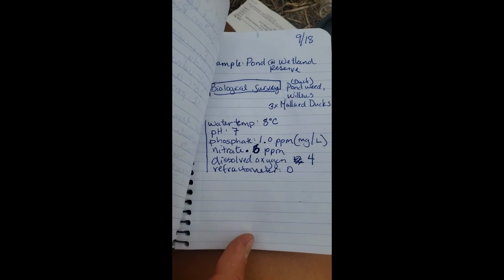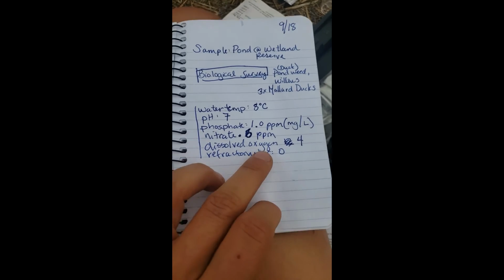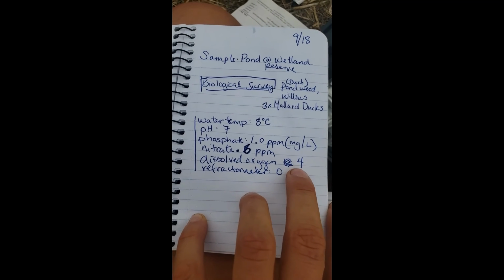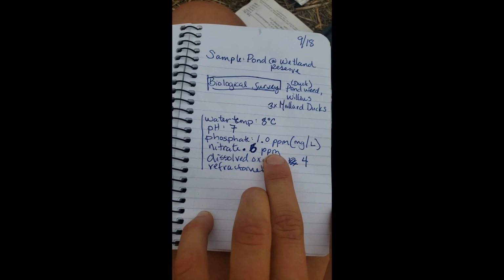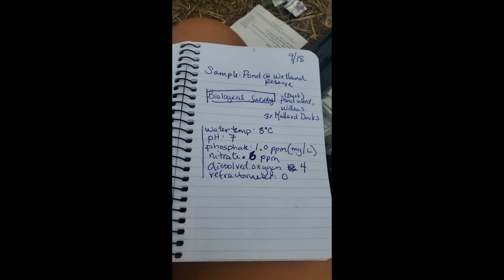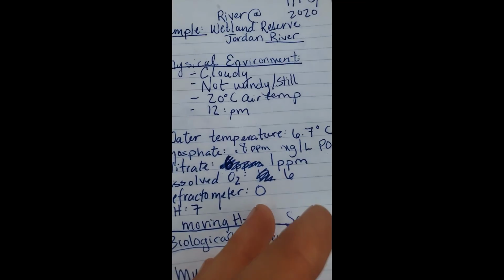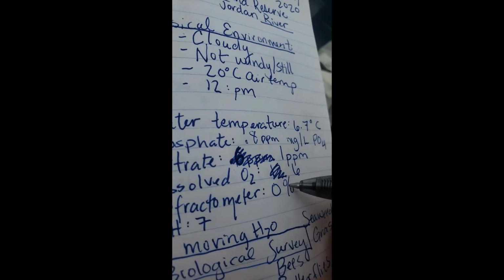Because I would agree, I would think that maybe the pond would have more phosphate, more nitrate, there's no moving water, and because of that, more things grow, like that duckweed, which is taking over the whole pond. And because of that, there would be less oxygen due to more organisms living in the water and using up more of the oxygen as they do respiration. Both of the samples you could see through, so the refractometer had them at 0%. Let's make sure we don't have any naked numbers here. But this was 0% saturation.